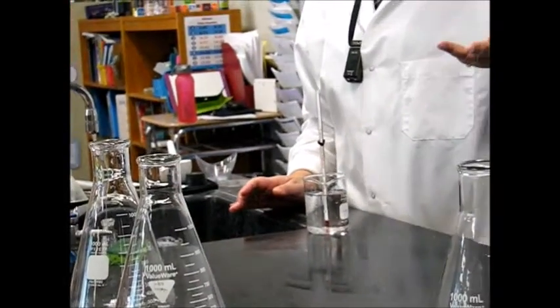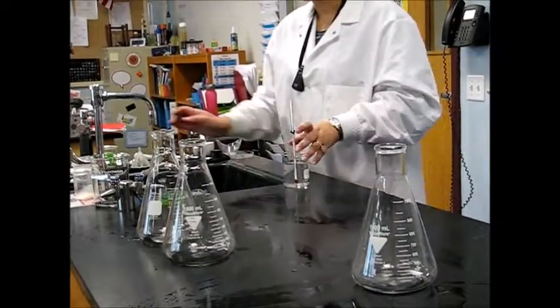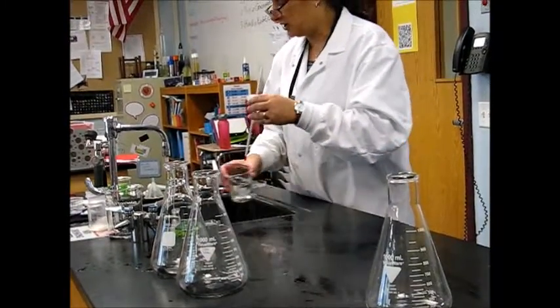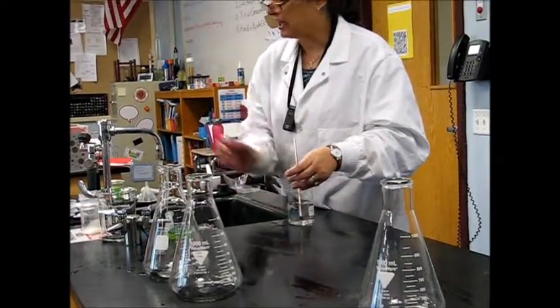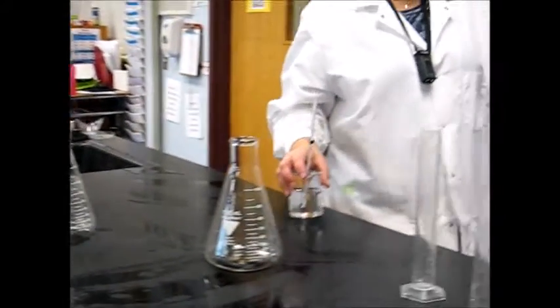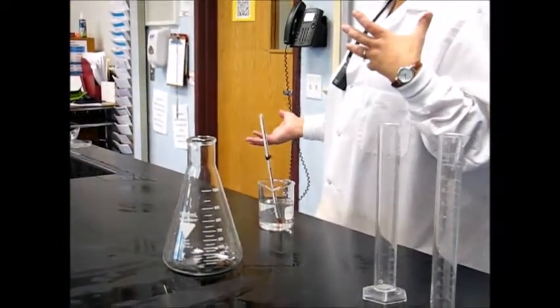This reaction usually happens pretty slowly. You wouldn't normally even see the bubbles, but we're going to do something to speed the reaction up. What we're going to do is add what's called a catalyst. A catalyst is something that speeds up a chemical reaction. An inhibitor is something that slows down a chemical reaction. And the really cool thing about catalysts and inhibitors is that they're not actually used up in the experiment.